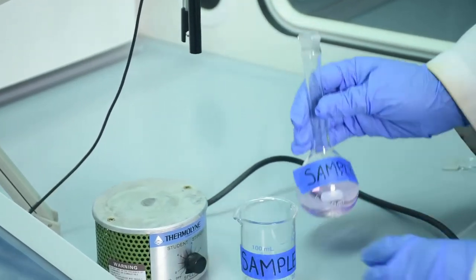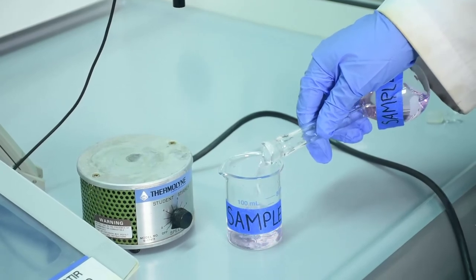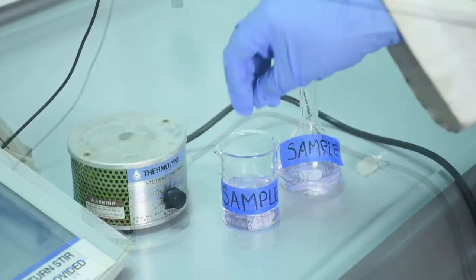Pour the solution you're measuring into the sample beaker that was previously rinsed and place the clean, dry stir bar into the beaker.